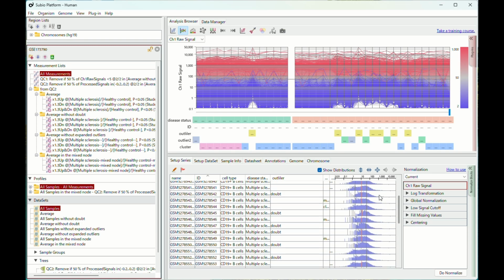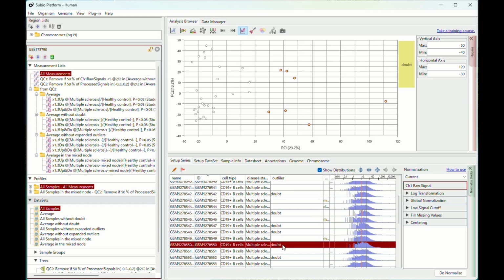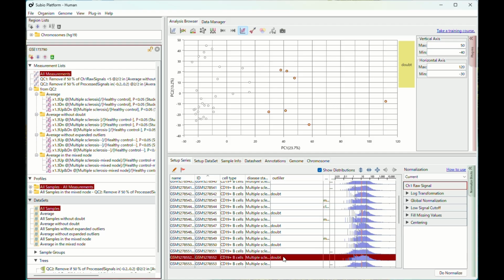The distributions of CPMs shift to the right in the histograms of those samples, and the sample numbers are close together, except for one control sample. It might indicate the batch effect. In the PCA results, principal component 1, which explains 24% of variance, is driven by the low total reads, you may assume. So I marked them as doubt.